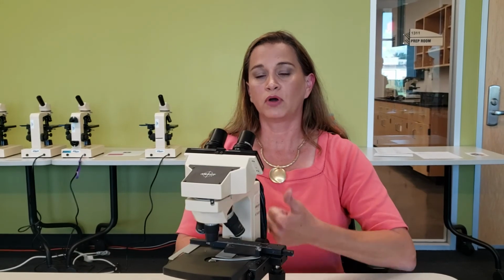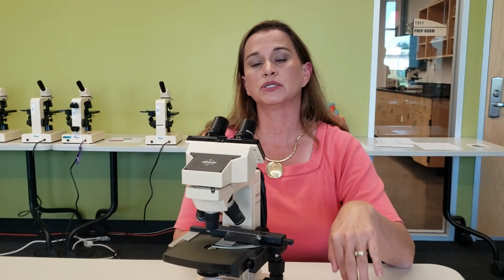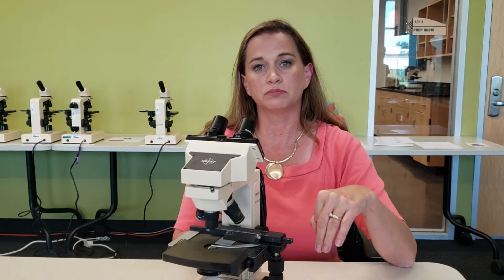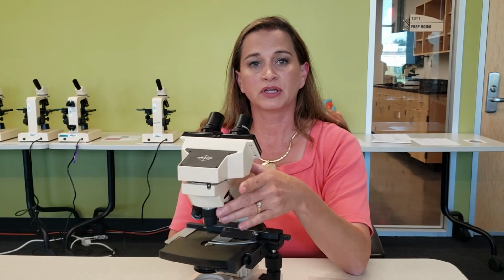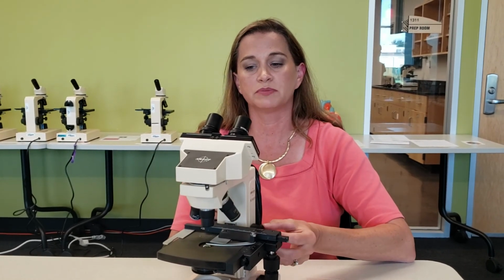I would say first, learn your parts and the functions, and then two, you can come to a professor or you can come into HNS 1300. I can walk you through how to use the microscope, and then I can set you over to the side and you can just play with a microscope slide and practice at adjusting both the magnification using your objectives and the focusing using your coarse and fine adjustment knobs. And I can walk you through all of it, and you can practice as you sit here in the study lab.